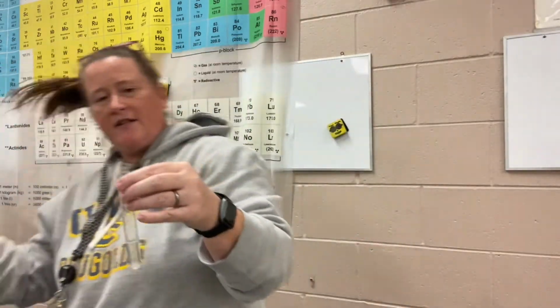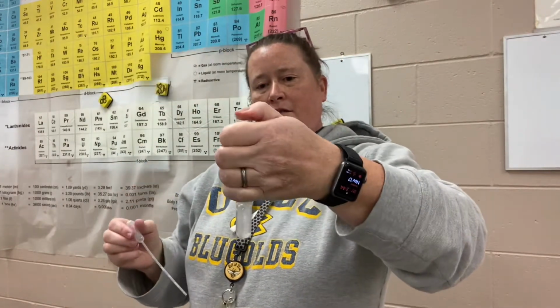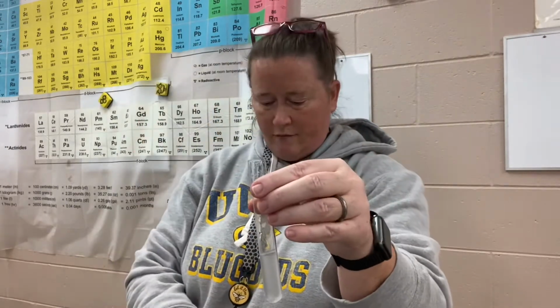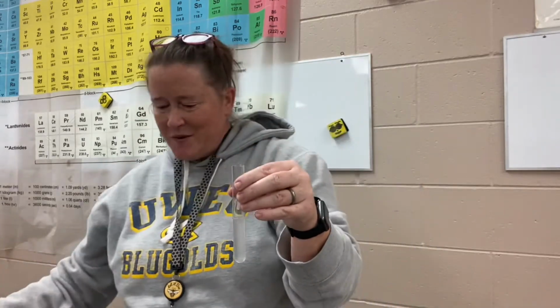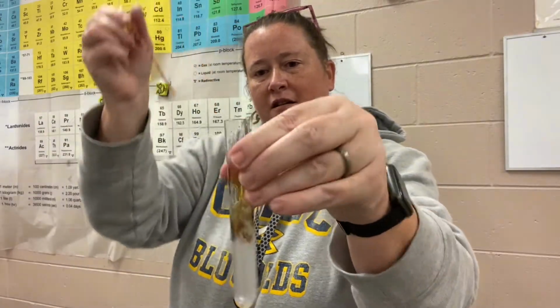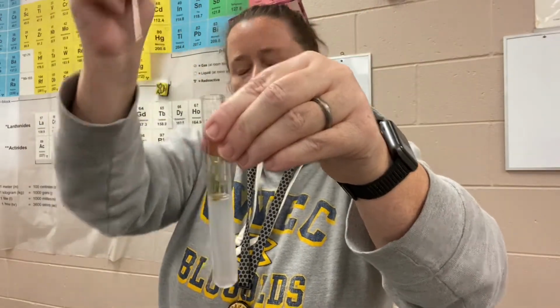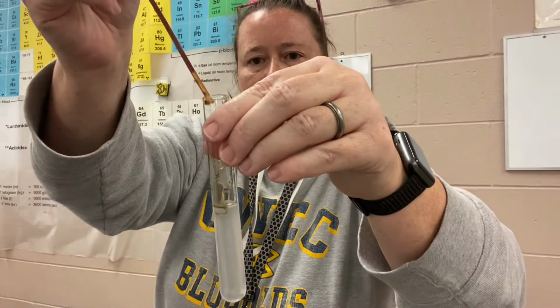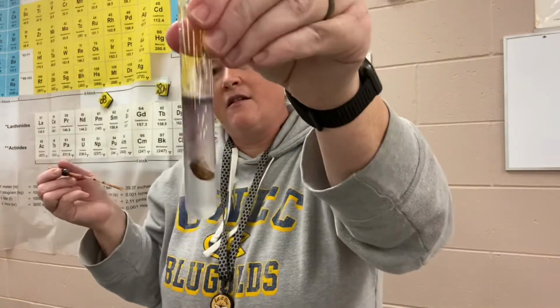It makes me wonder if there's any starch left in there. Okay, I know that there's some starch in here now. Oh, I saw it turn purple just for the briefest moment. That's how we know we're getting close. But eventually we're gonna get to a point where the color remains. So we're approaching what's called the end point. When all of the vitamin C is used up, the color will change permanently.